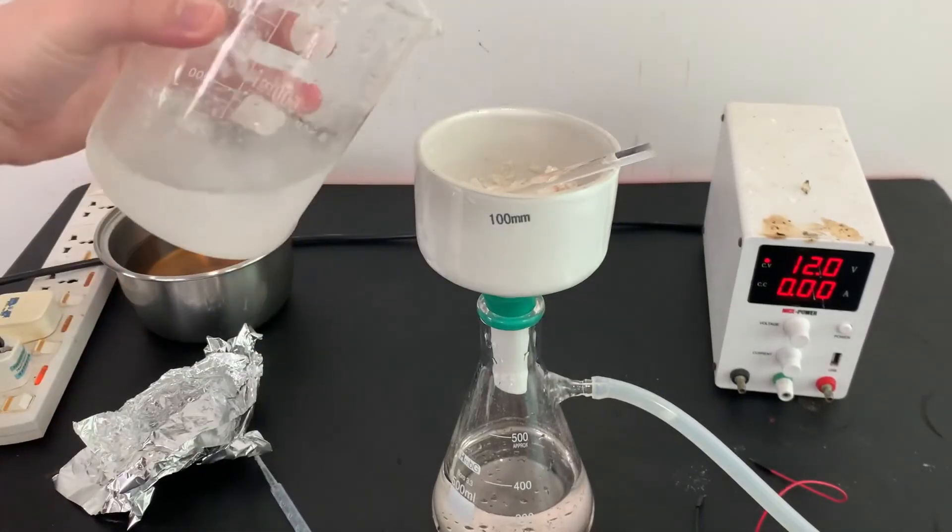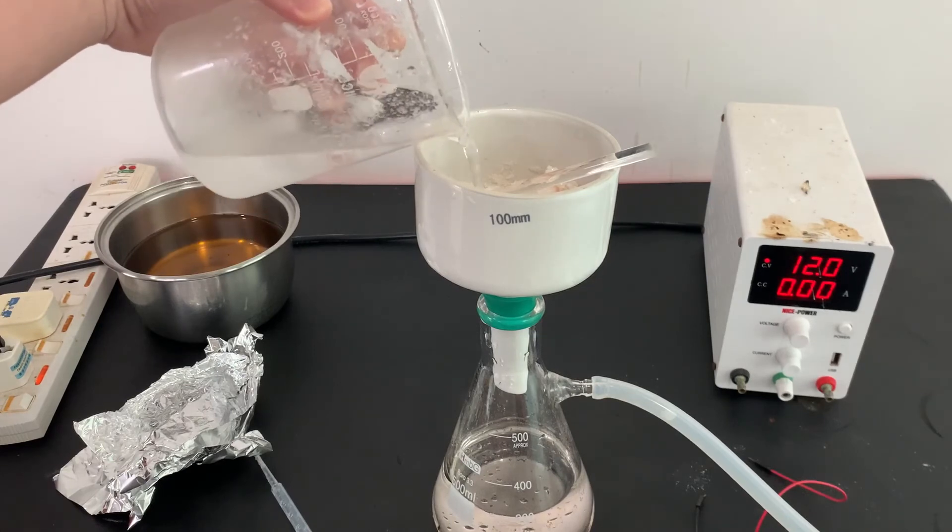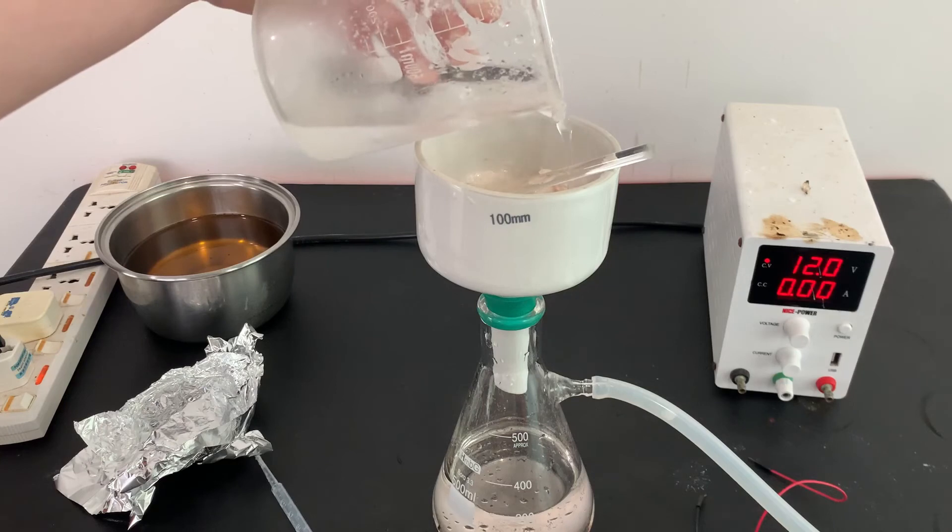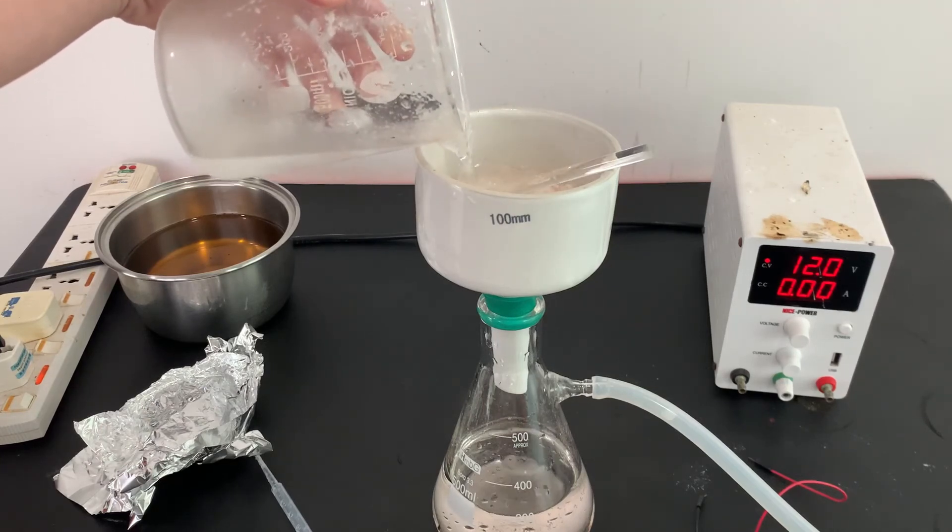The acetanilide was then filtered and washed with cold water. I then dried the pure acetanilide on a drying dish in the oven for a few hours.